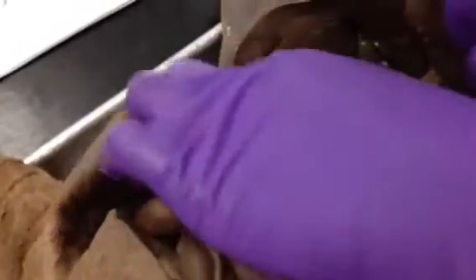And then if you kept sticking your probe through, and when it came out this other end right under here, you would have a hole kind of where the caudate lobe is, and that hole is the epiploic foramen. And that's more definitional. And then, so you follow the stomach, and you go to the right side of the cat, kind of near where the caudate lobe and the kidney were.